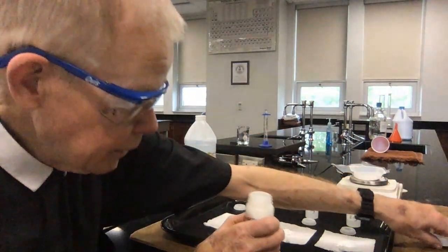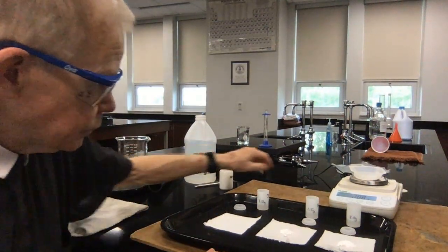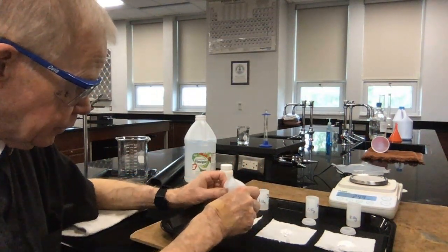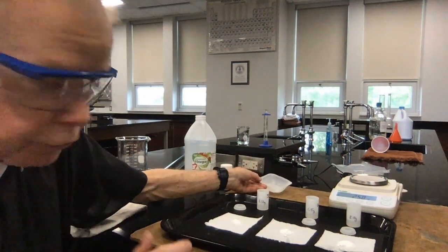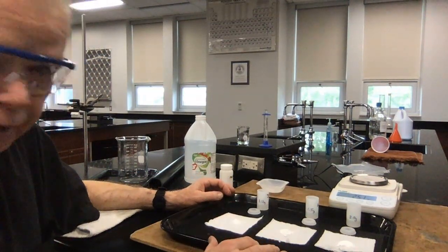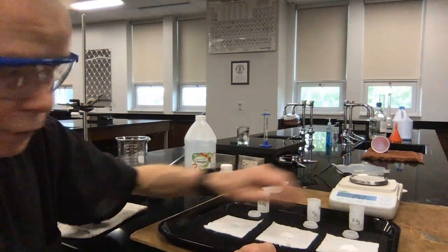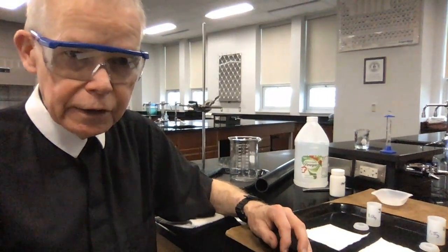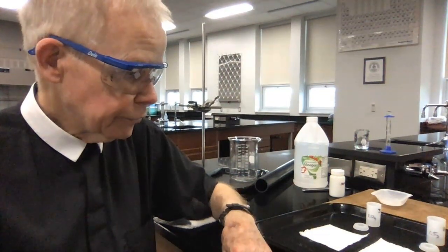We'll put that aside. And what I've done is I've put the sodium hydrogen carbonate, baking soda, on top of 3 pieces of toilet paper. Toilet paper. Call it tissue if you need to. So my next plan is to take these outside, down in the plaza, and wrap up the toilet paper, put it into the canister, and let the reaction take place. It'll build up some carbon dioxide and hopefully push the lid off. That's what we're aiming to do.